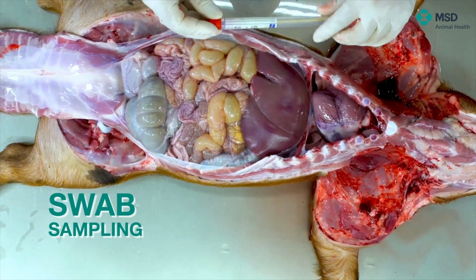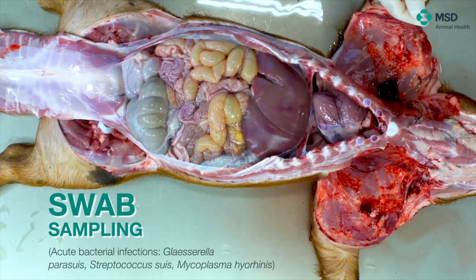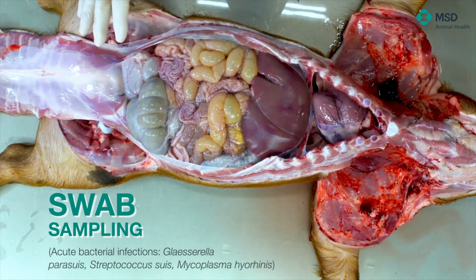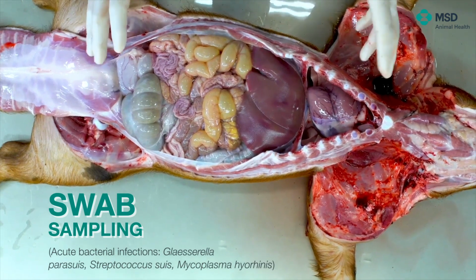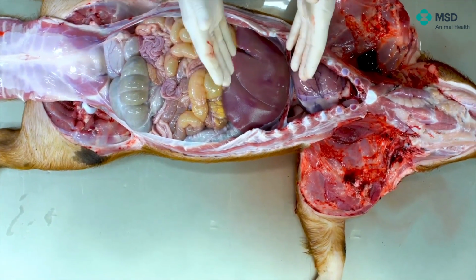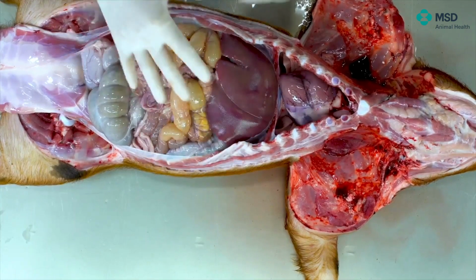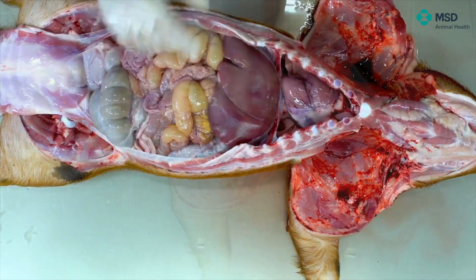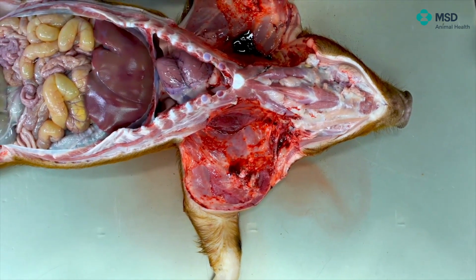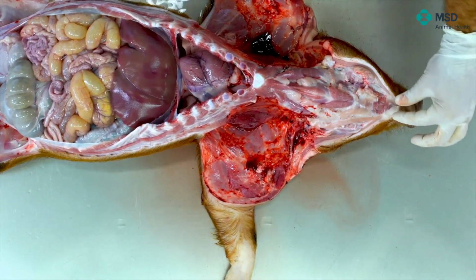Okay, at this stage, it's very important to see if all the organs are in the right position and in the right situation. As you can see, in the abdominal cavity, you always see the liver. Sometimes the spleen is not observable because it's still covered by some of the intestinal loops. We have the urinary bladder, here we have the cecum, and mainly a small intestine. Well, first of all, we like to take from the tongue, following the trachea, esophagus, lungs, and heart as well.